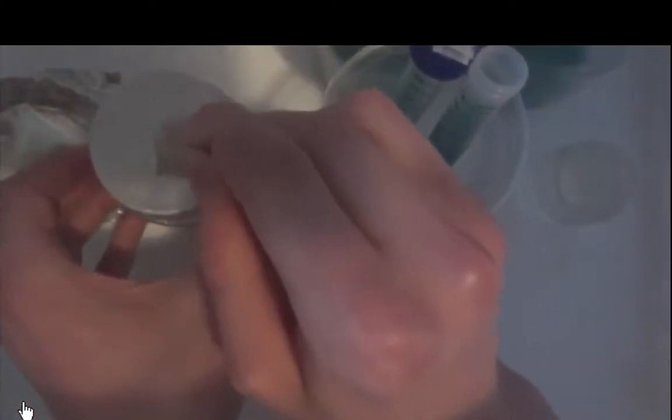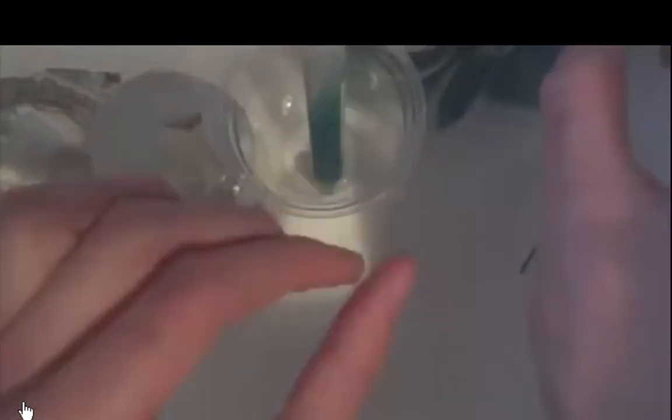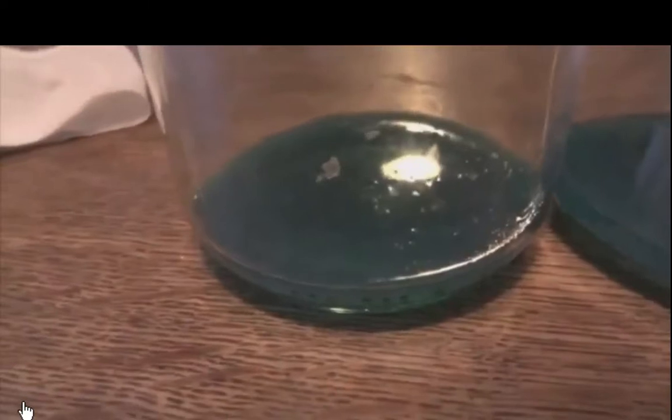I'm also making some culture slants. This will hopefully allow me to store this culture in the fridge for quite a while. As you can see, I just cut a small chunk of colonized agar and place it into the slant. They will then be incubated for about a week to 10 days at 20 to 24 degrees.